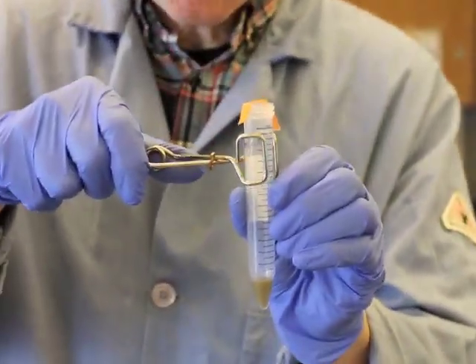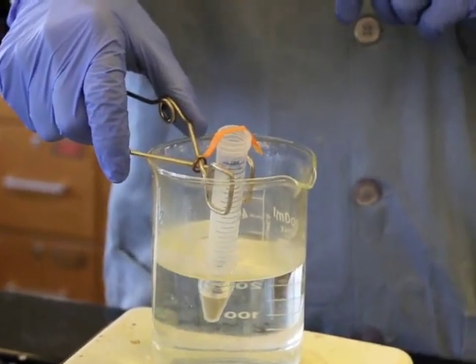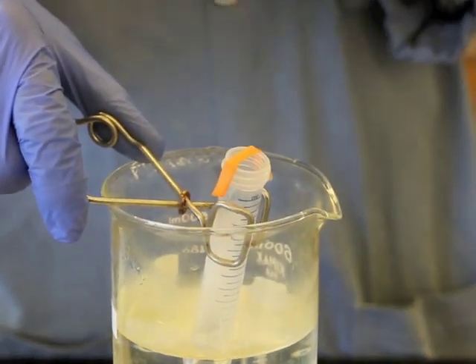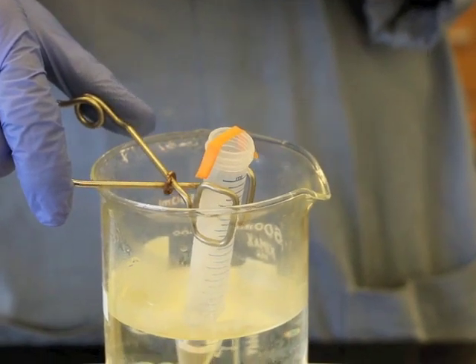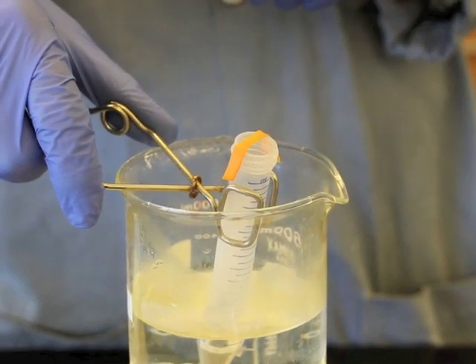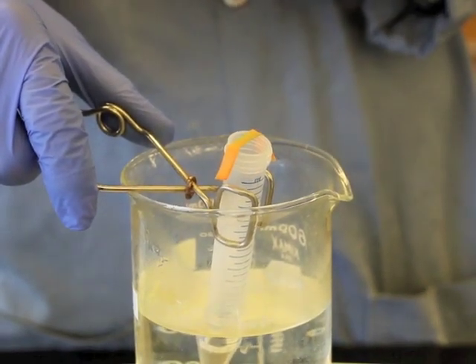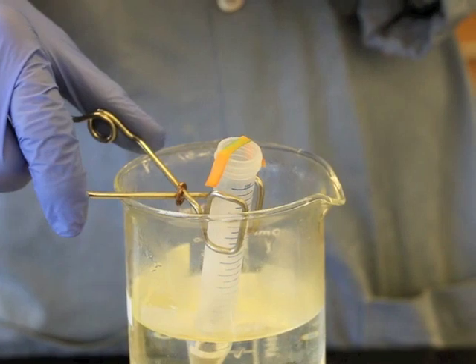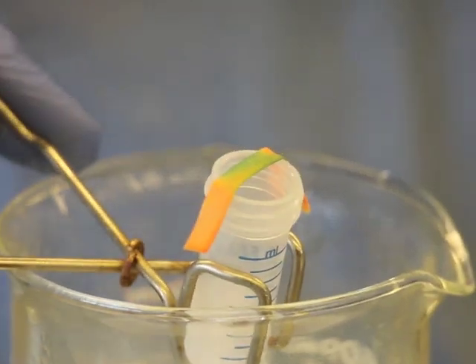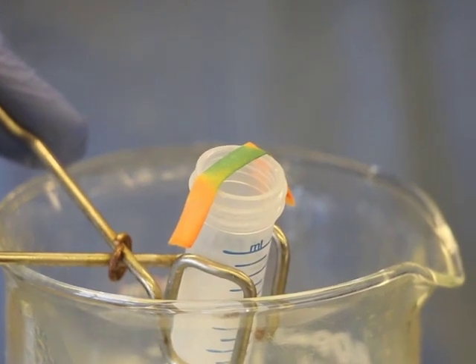Now what I'm going to do is I'm going to place this in our hot water bath. Pay close attention to the pH paper. If it turns green, that means that it's being exposed to a base. Ammonia, NH3, is a weak base. It's also a gas. So heating this liquid up will cause the gas to move through the air, to interact with the dye molecules on this pH paper, and change that paper green. You can see it working very nicely, right? Right there, that tells you that ammonia is being produced inside that test tube.